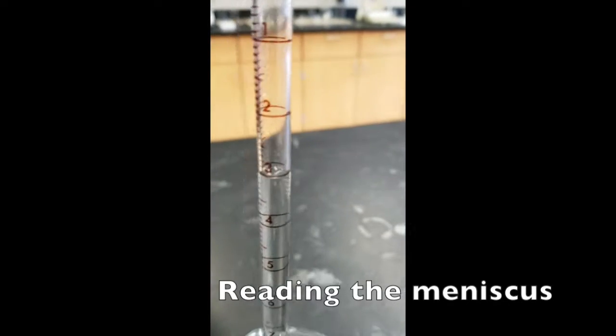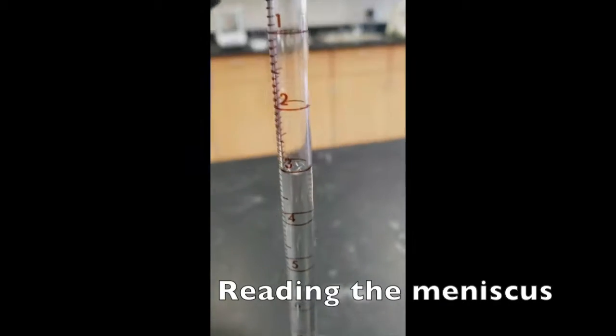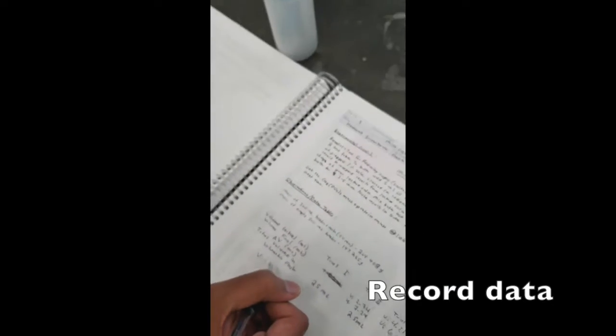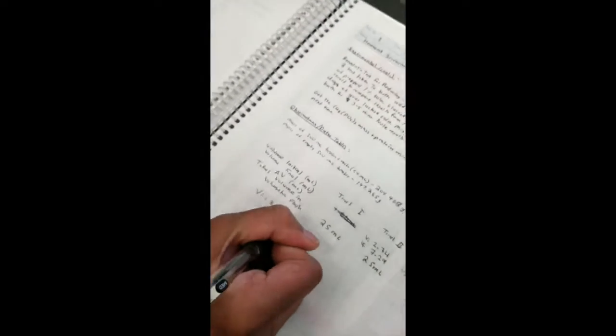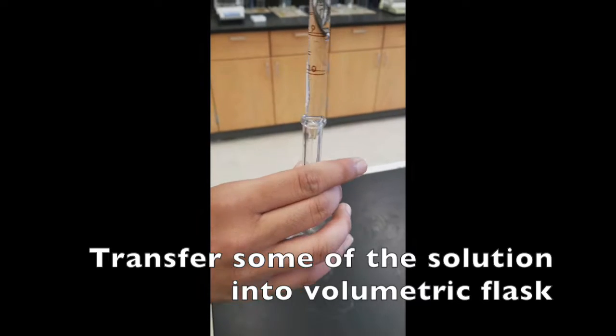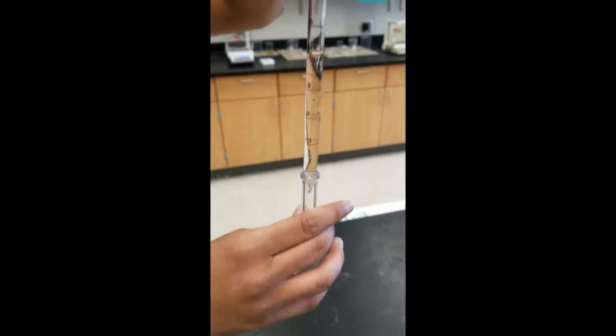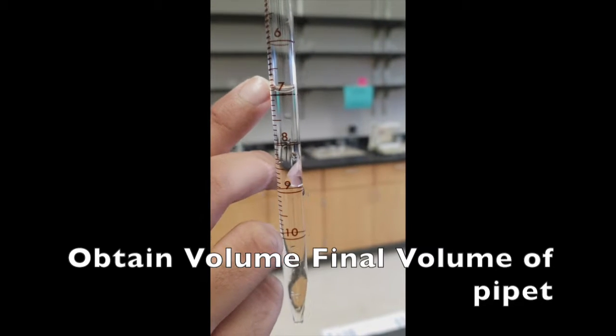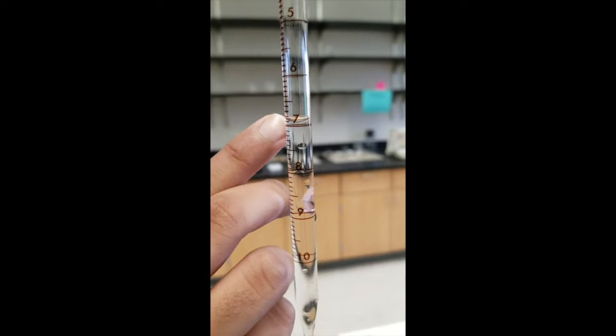Should be read at eye level, and in our case it is 3.19 milliliters. So our V1 is 3.19 milliliters. Well, 6.87, as you can see from reading the meniscus.